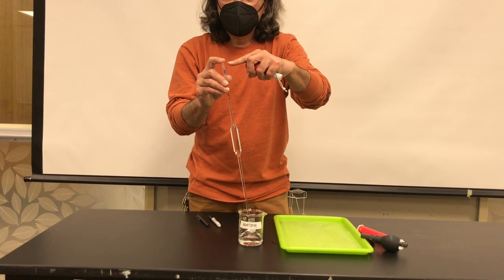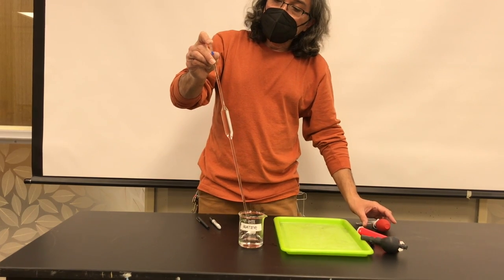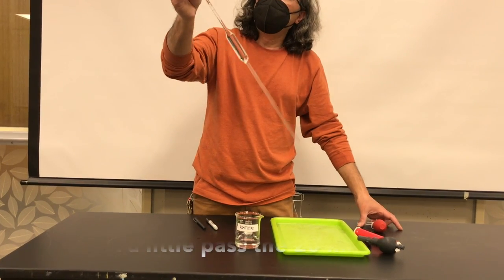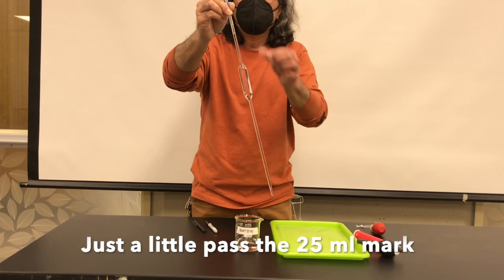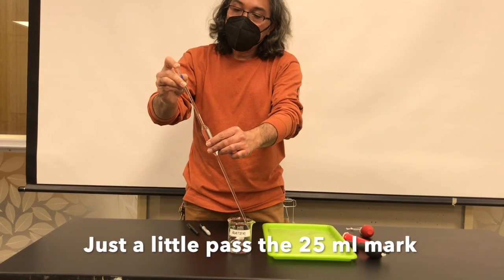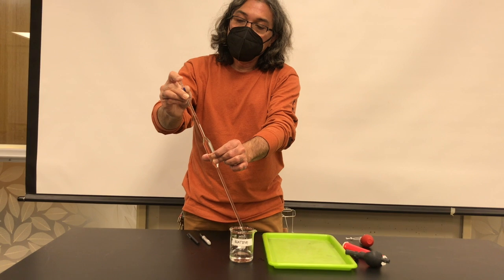So ideally you want to be just about where I am right here and then use your index finger to adjust the meniscus to the mark.